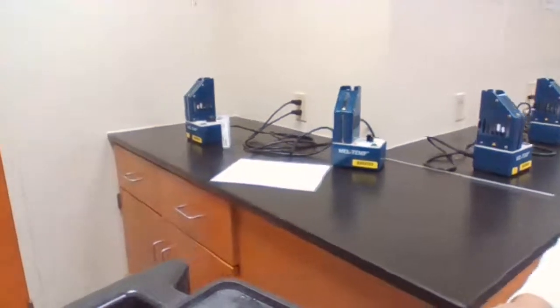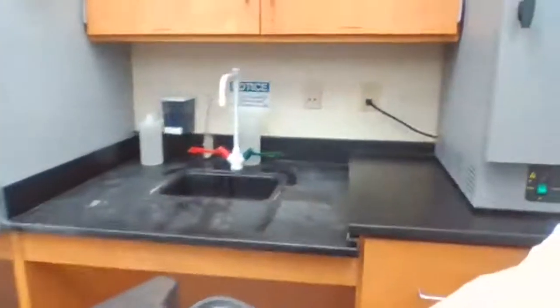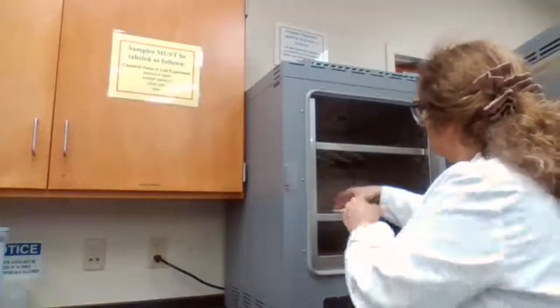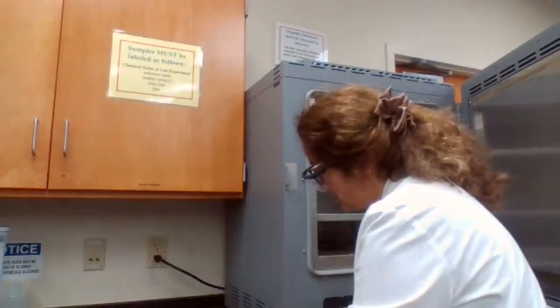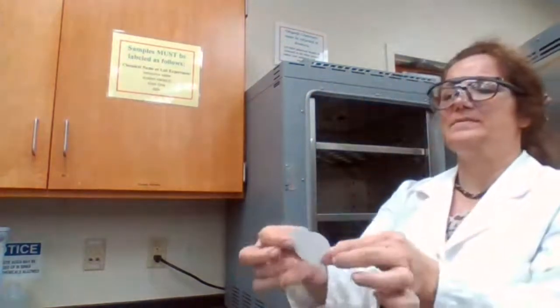Going back to the lab to look at the oven to make sure the sample is dry. You see this paper?